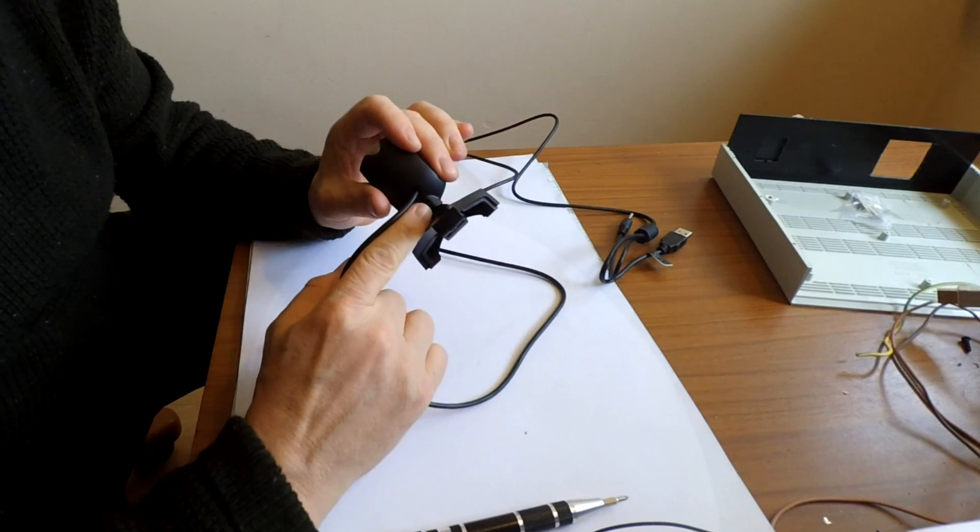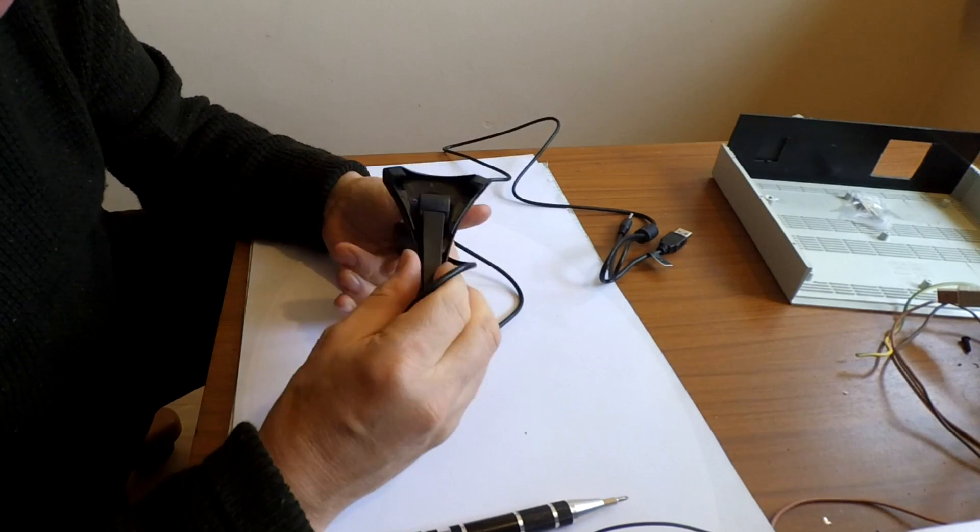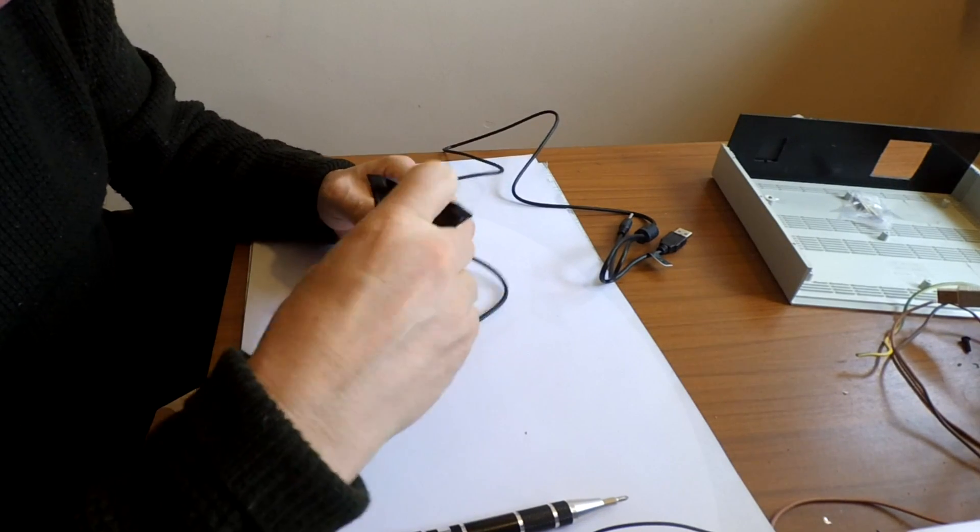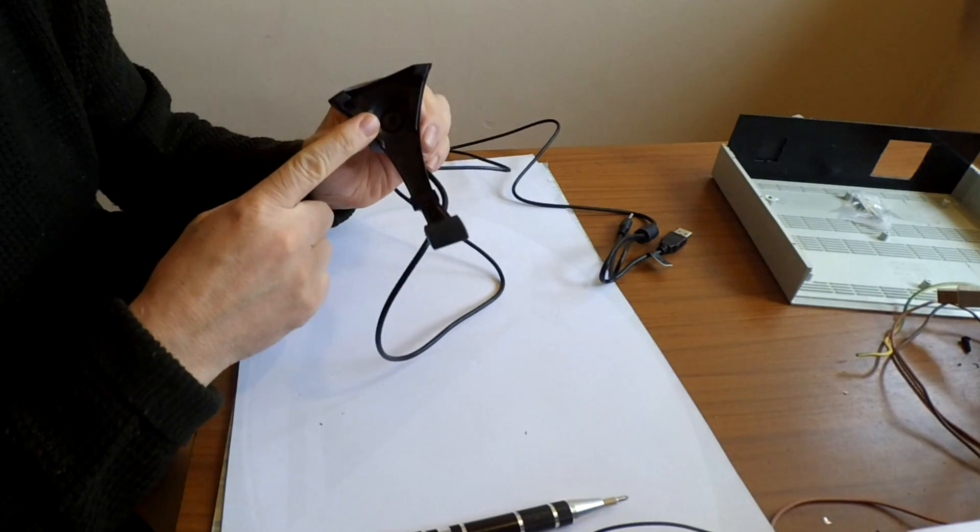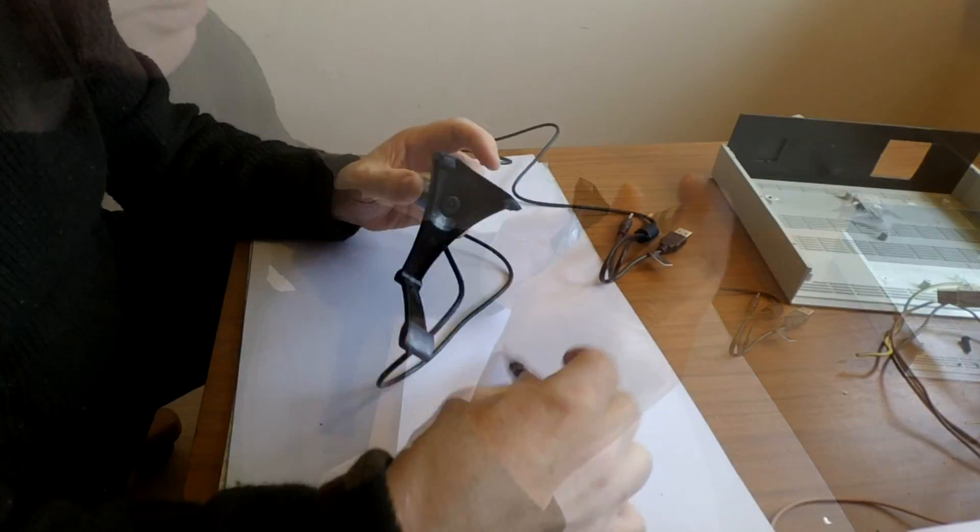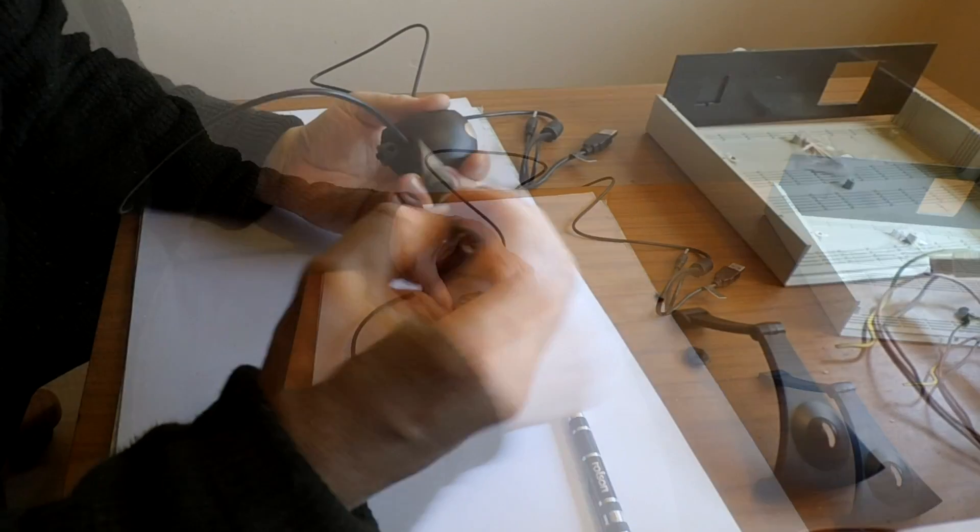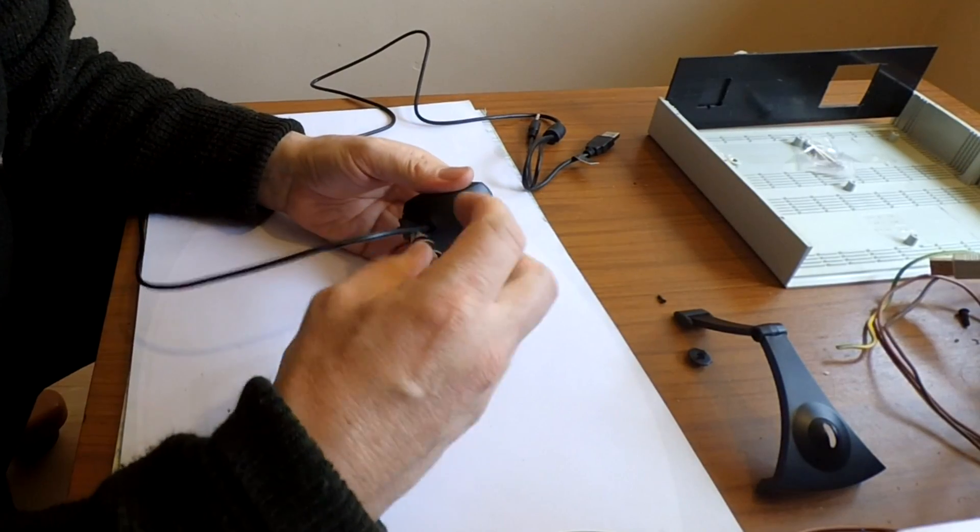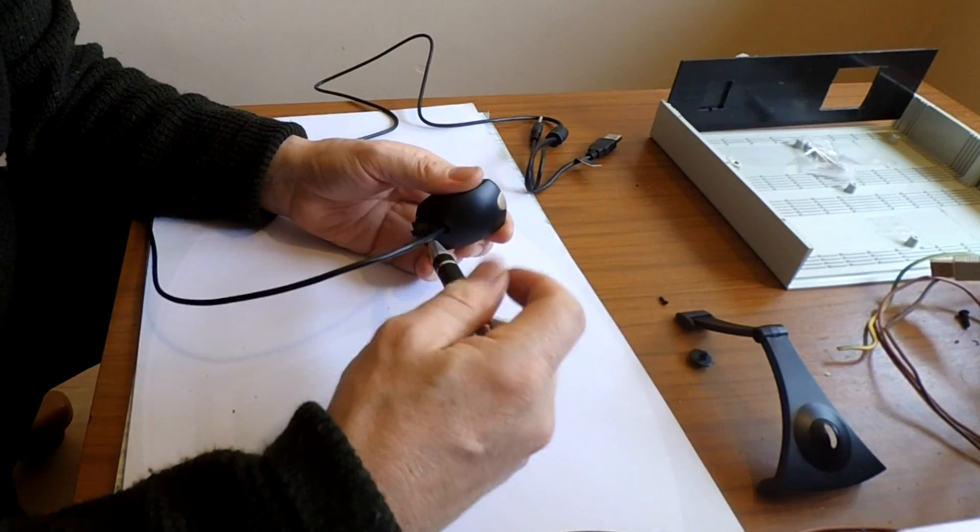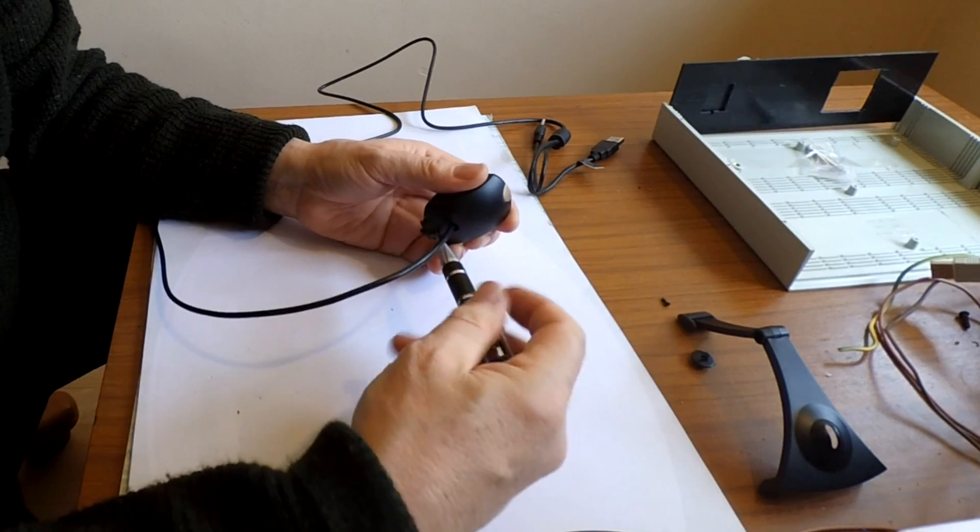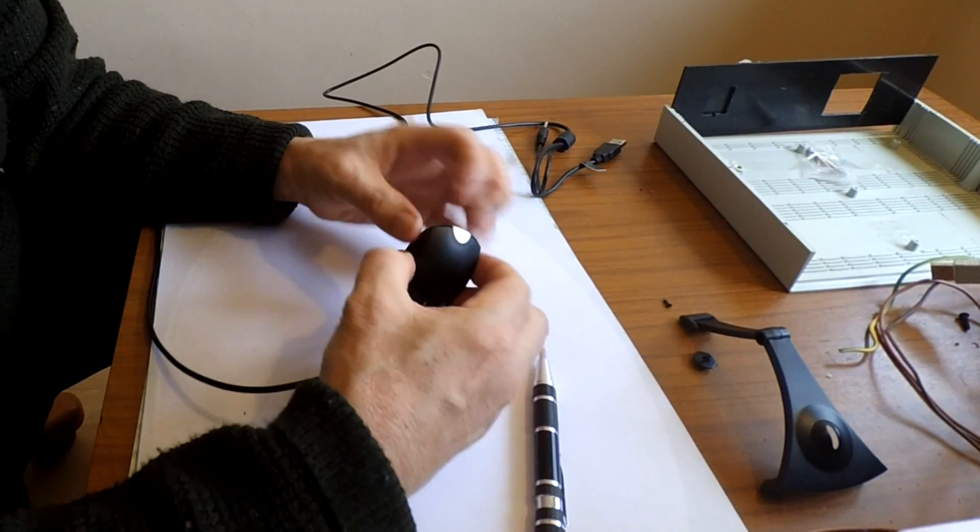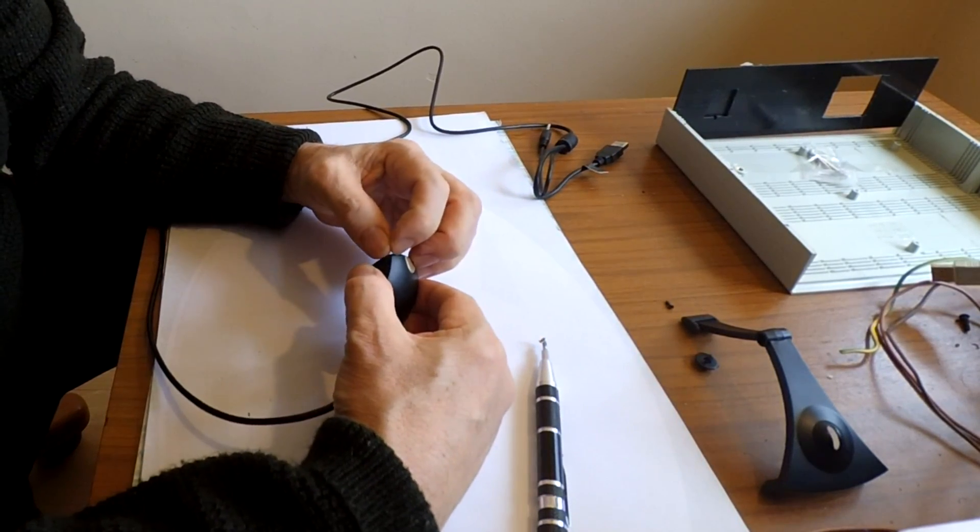Look for screws. There's a screw in there and there's a screw in there. So let's take that one out first. And now we'll actually get into it and see if we can see where the infrared filter is and whether it will break out in a friendly way or not.